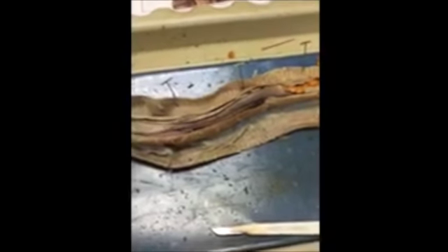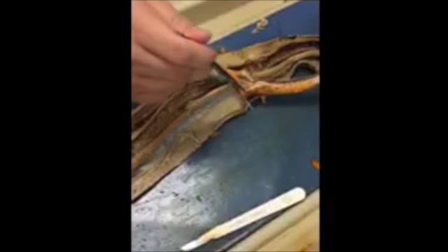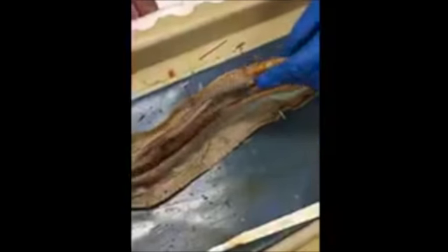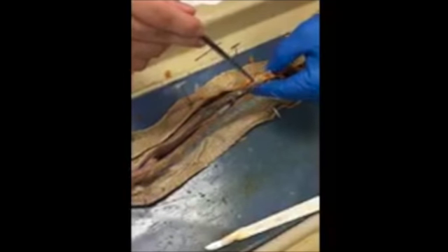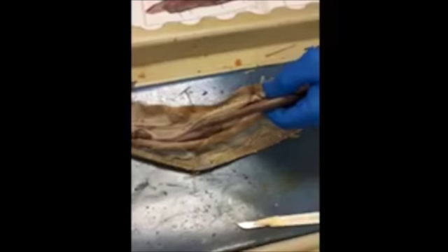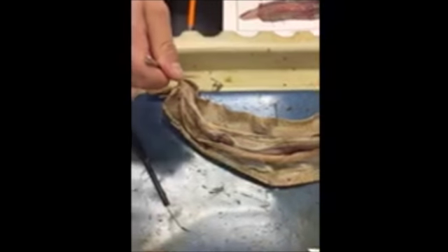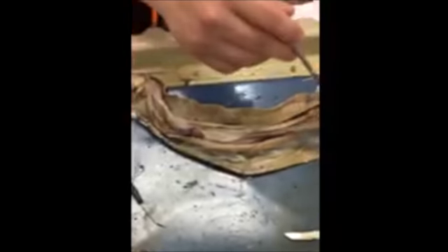Next, we have the digestive system, and the digestive system is going to include the esophagus, which is going to be right here, and the esophagus leads to the stomach, which is this big organ right here, which leads to the intestines, which are going to be these squiggly items down here. The digestive system also includes the gallbladder, which is right here, and the liver. So the esophagus is going to be this one right here, and it leads all the way to the mouth, and it's what takes in the food, which leads to the stomach.